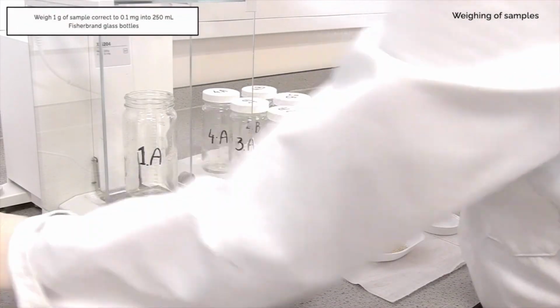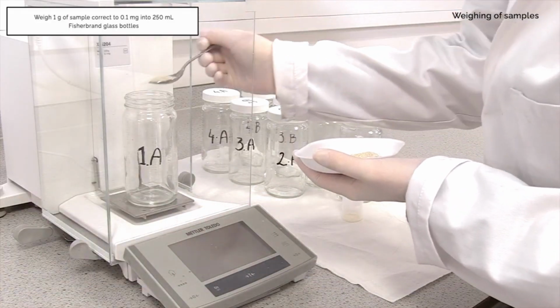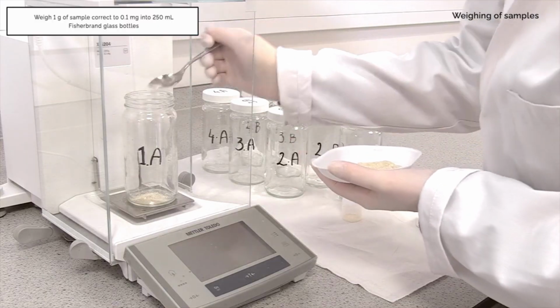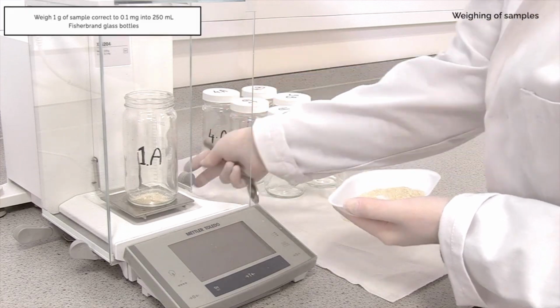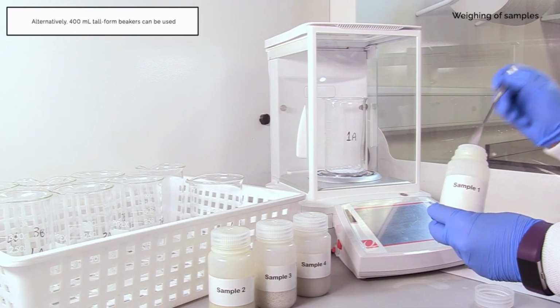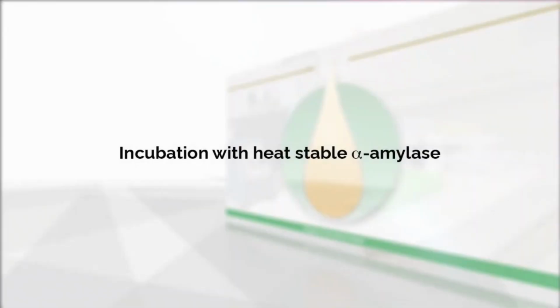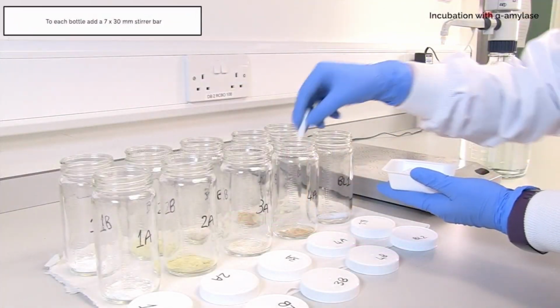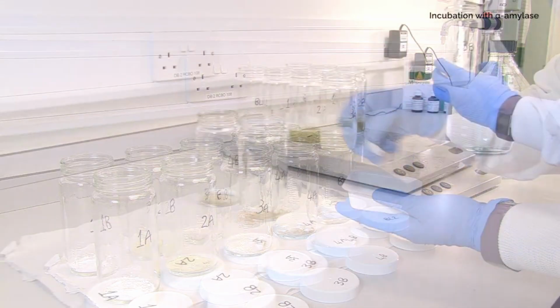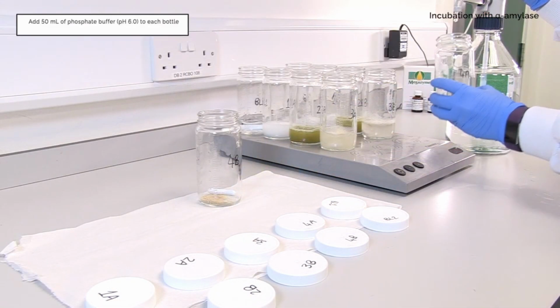Weigh 1 gram of the sample correct to 0.1 milligram into 250 milliliter Fisherbrand glass bottles. Alternatively, 400 milliliter tall form beakers can be used. To each bottle, add a 7 by 30 mm stirrer bar. Add 50 milliliters of phosphate buffer pH 6 to each bottle.